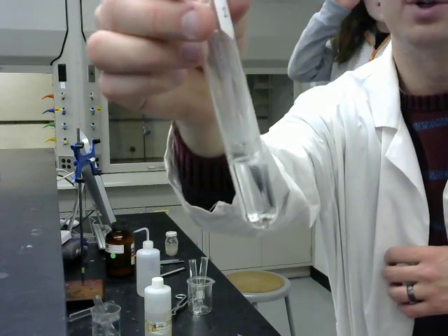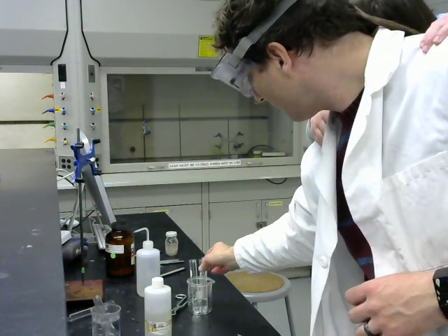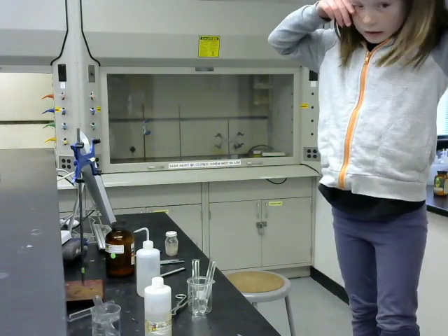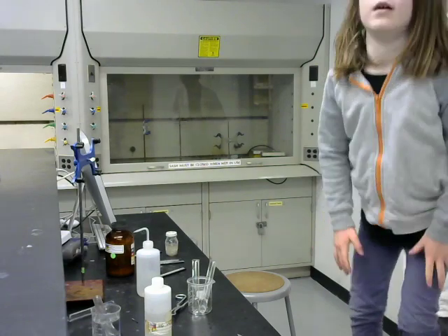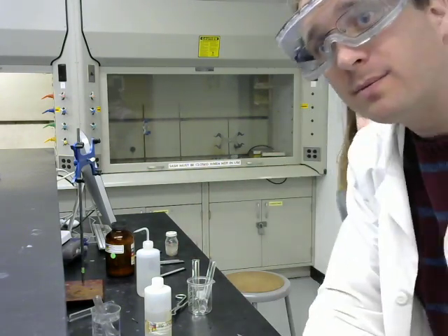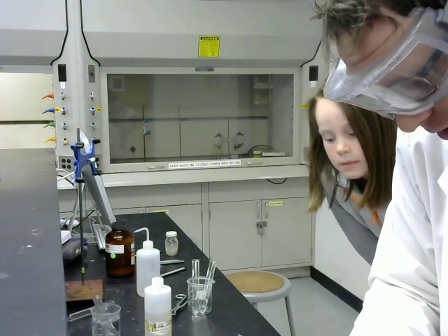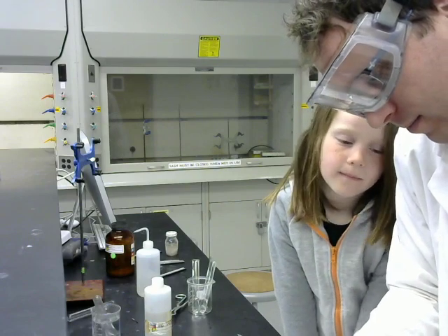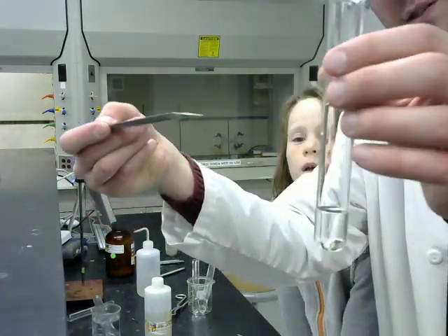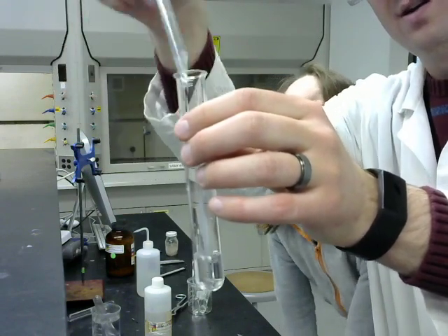Okay, so it's bubbling and fuming. Now, we'll do aluminum. So again, we have this fine aluminum powder, and making it in a powder form increases the reaction rate, such as it may be. So there's the aluminum.